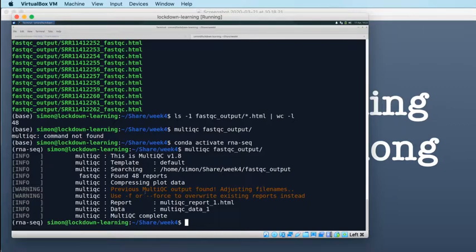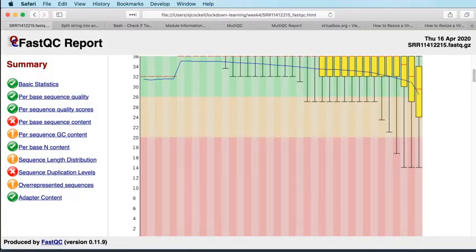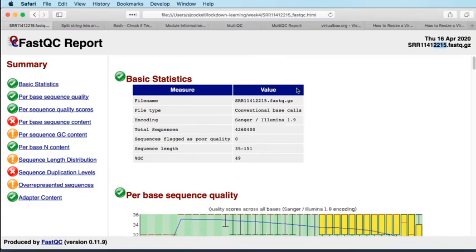But what I wanted to do first of all was take a slightly more detailed look at a single FastQC report, and try to talk a little bit about some of the assumptions that FastQC makes when it's creating the assessment of the FastQC report for you. So what I've got here is again the FastQC report that we generated yesterday. So this is for that 2215 file, the first FastQ file in our set of 48, and I'm just going to run through this one report as an example of the output of FastQC. So FastQC produces you this nice HTML file.